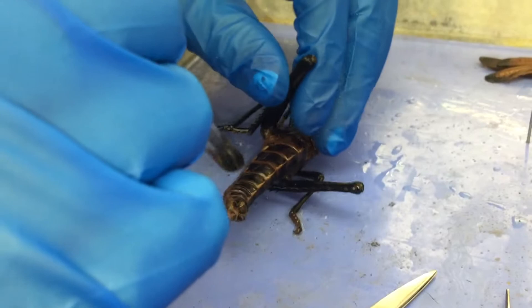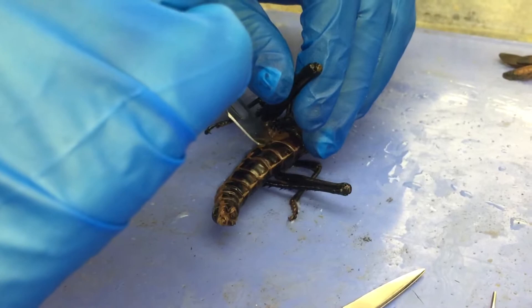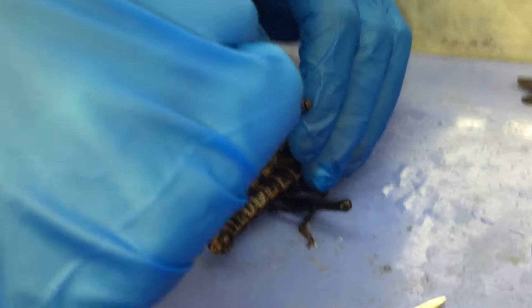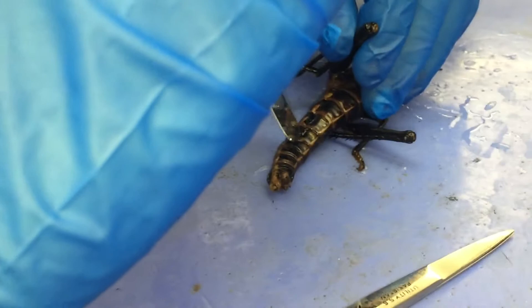I feel like I want to chop his legs off — they're all very exciting, even just cutting. God damn, you've got one thick hide going on there. This is really hard.